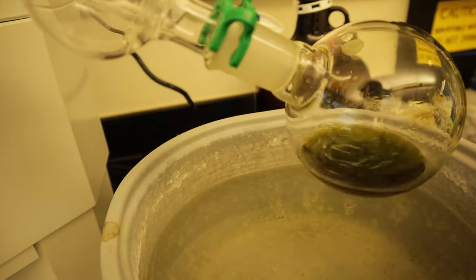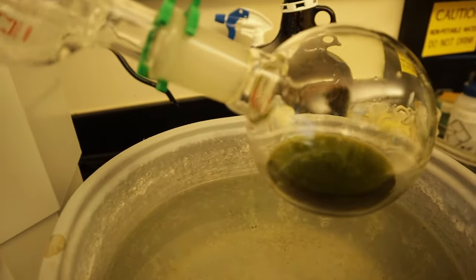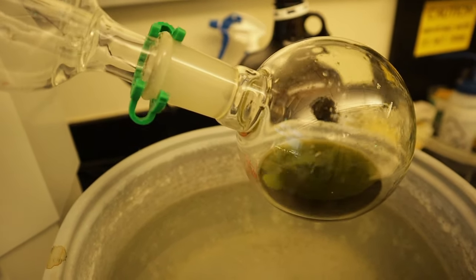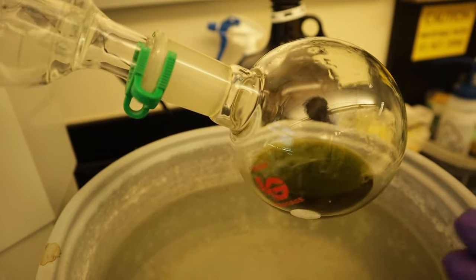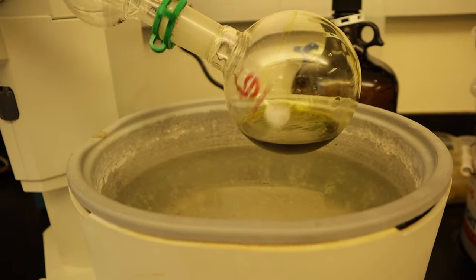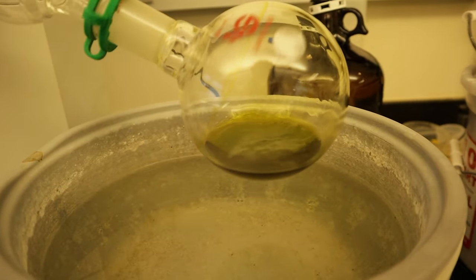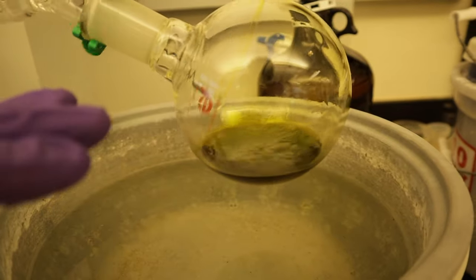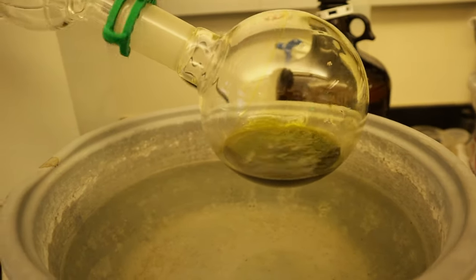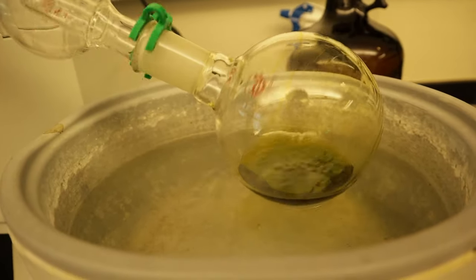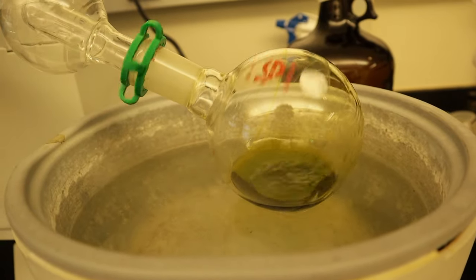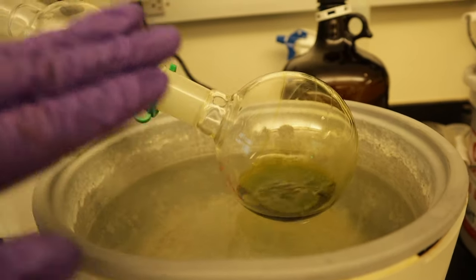When you see it is already bubbling, meaning the process has already started. By the time the solvent has already settled, if it is not bubbling, you can now lower it to the heating bath. Then, wait for it to evaporate.